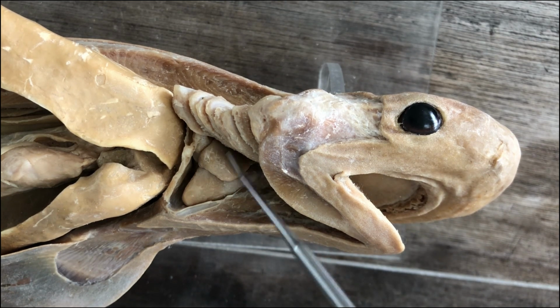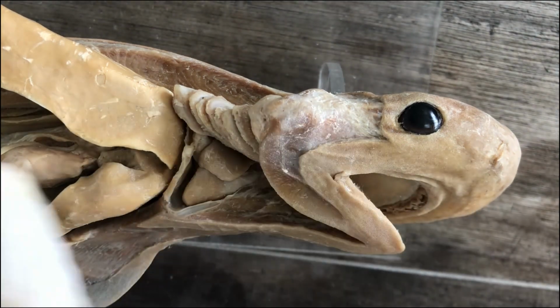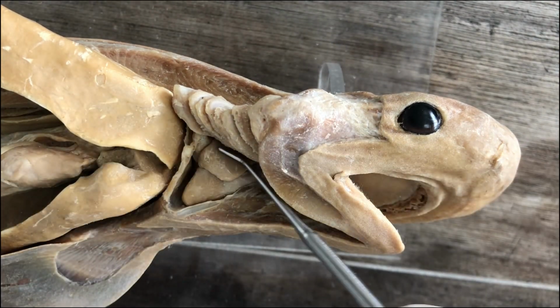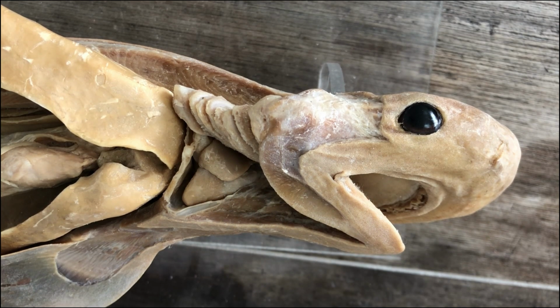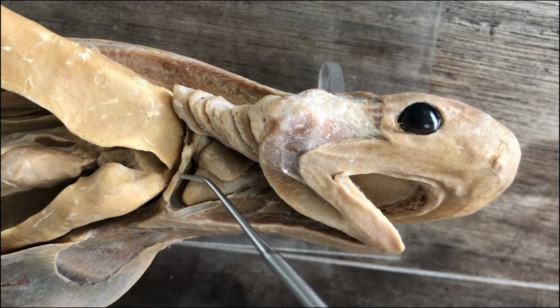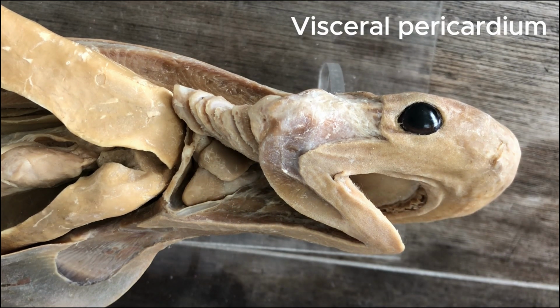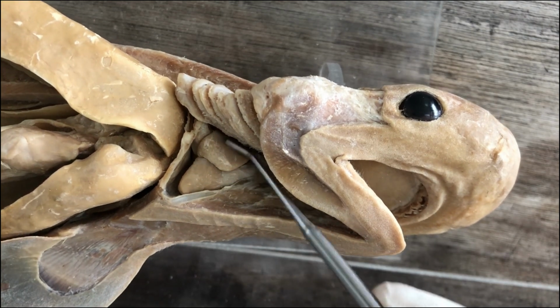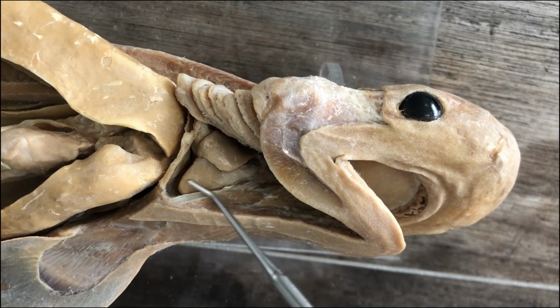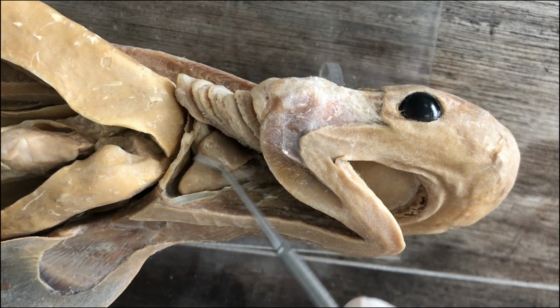And there's an inner coelomic membrane lining the visceral organs themselves, and that's called the visceral blank. So if you're referring to the coelomic membrane of the pericardial cavity, the inner one would be the visceral pericardium, and it's the serous membrane closely applied to the heart itself, and it's actually inseparable from heart tissue.